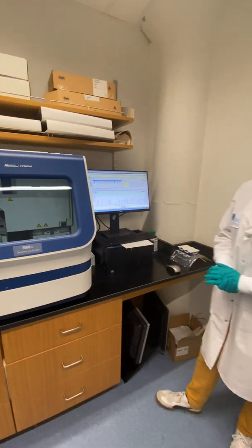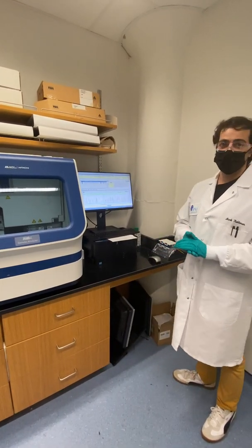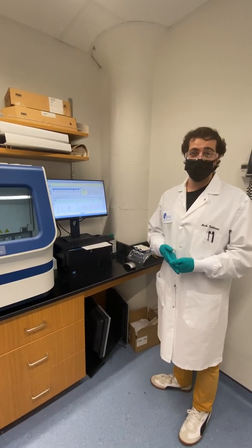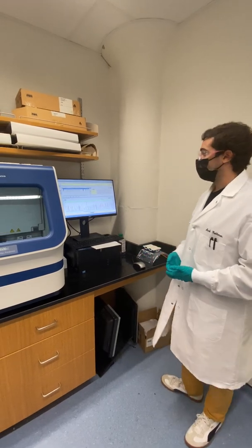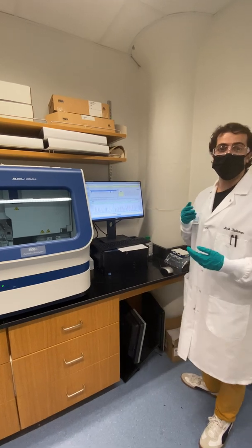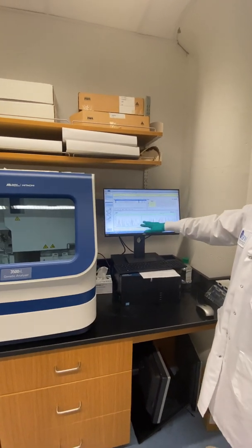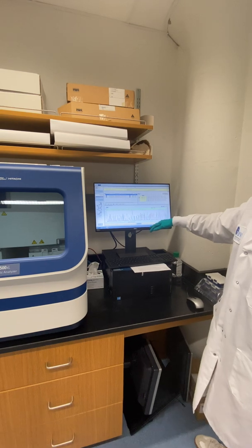This is our genetic analyzer. This machine allows us to read DNA sequences. Whatever we make, we need to make sure that it is genetically stable and has the correct sequence that we want. In case there are any mutations, we can catch them. We use this machine to read the sequence of what we have and compare it to the expected sequence. These right here are some of the trace files — you can see the different colors correspond to the different nucleotides.